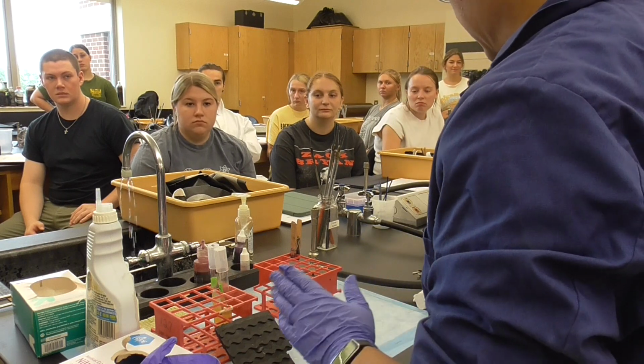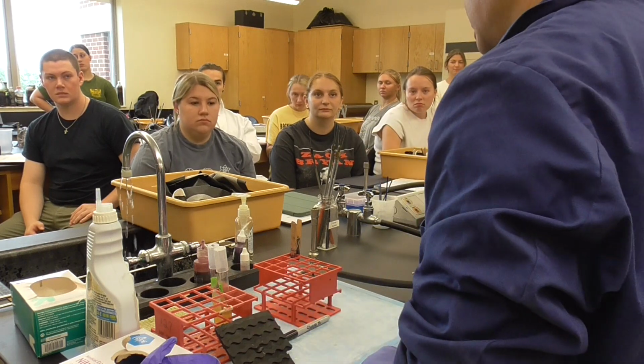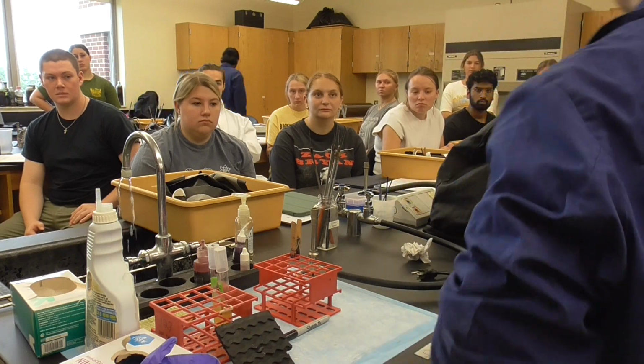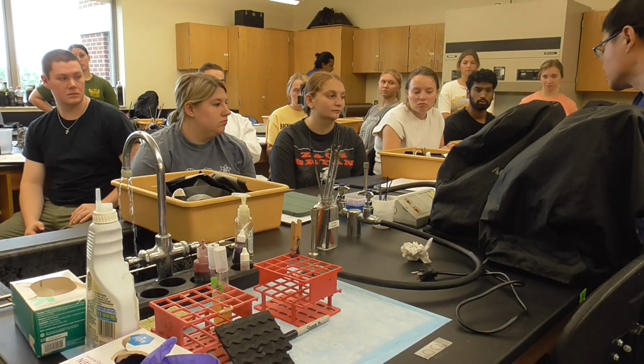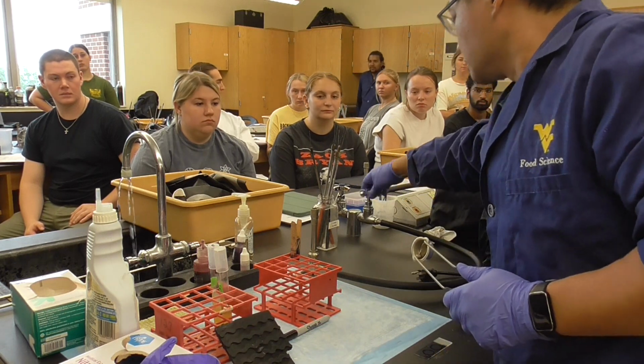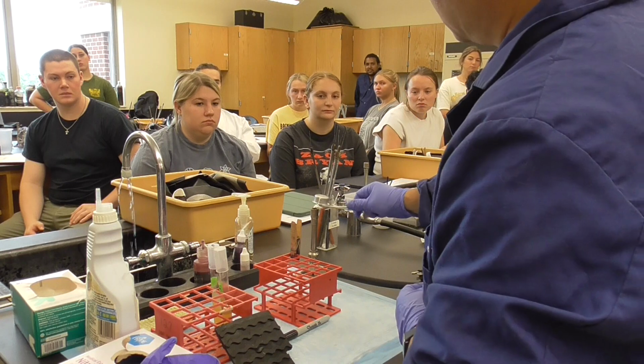Now we're going to put the bacteria, but before that we're going to put the water. So how do we do it? The Bunsen burner, I have to turn it on. And we need to use this called a striker. We turn it on when you hear the gas.